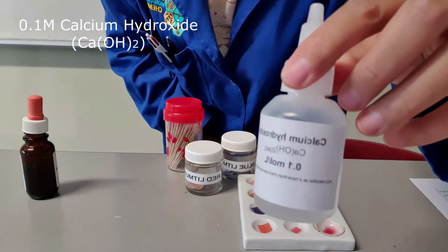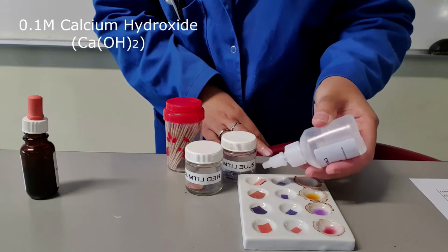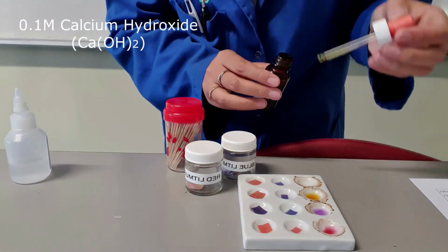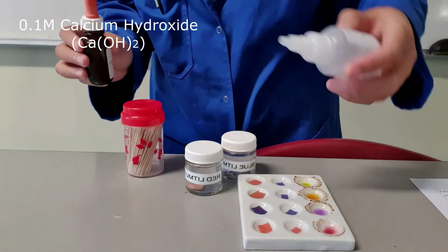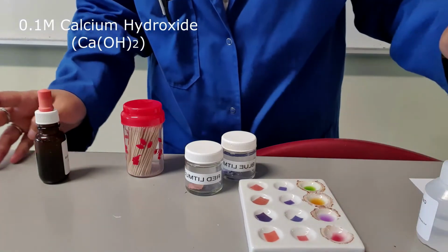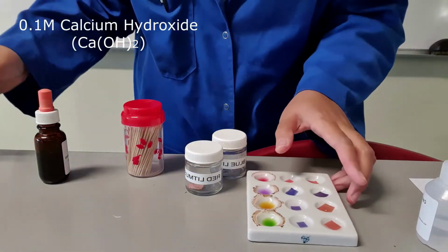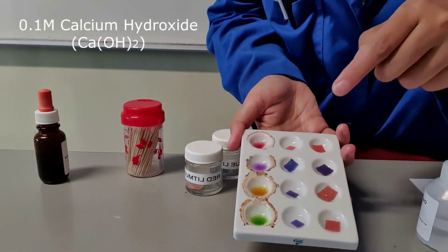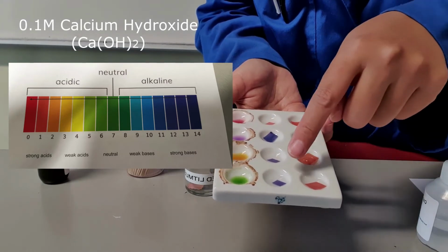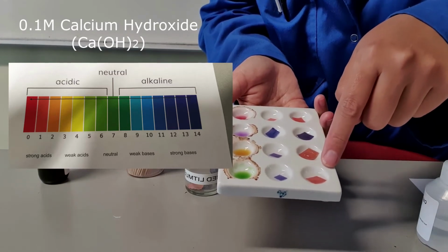Next one is calcium hydroxide. On red litmus paper, blue litmus paper, universal indicator. Okay, I will rotate it so it's easier for you to see. So that is calcium hydroxide in universal indicator, calcium hydroxide on blue litmus paper, calcium hydroxide on red litmus paper.